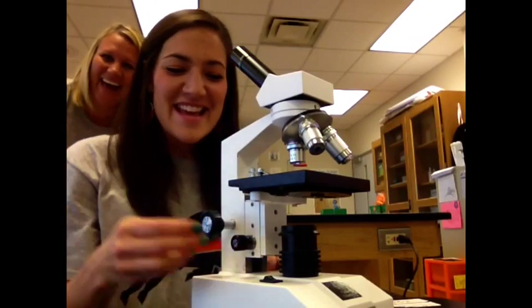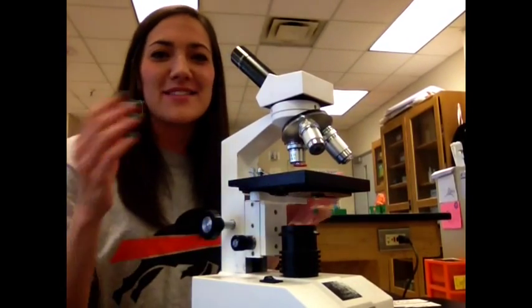Hi, everyone! You might have to adjust this based off of your eyes.